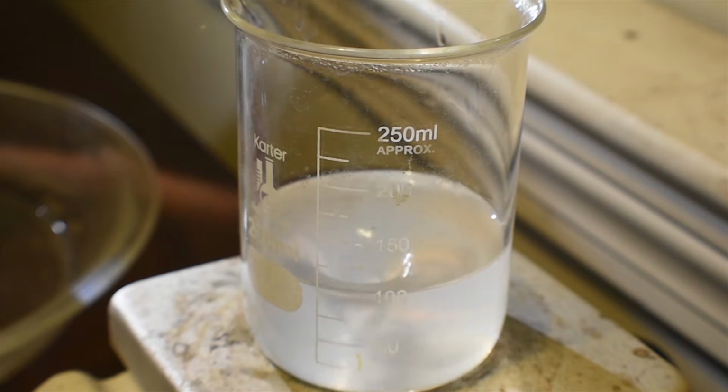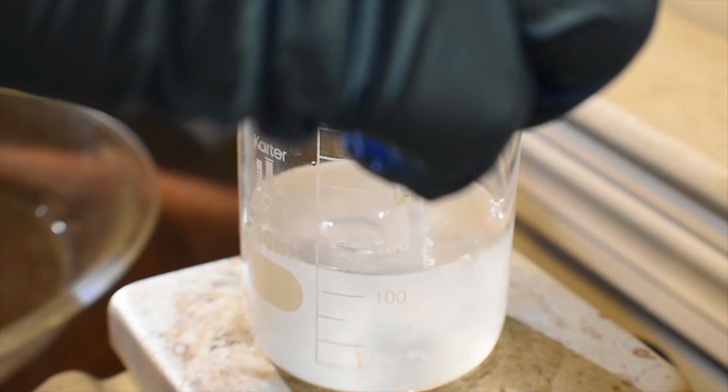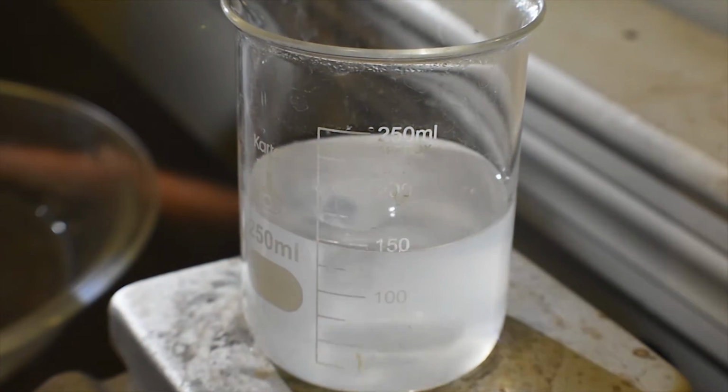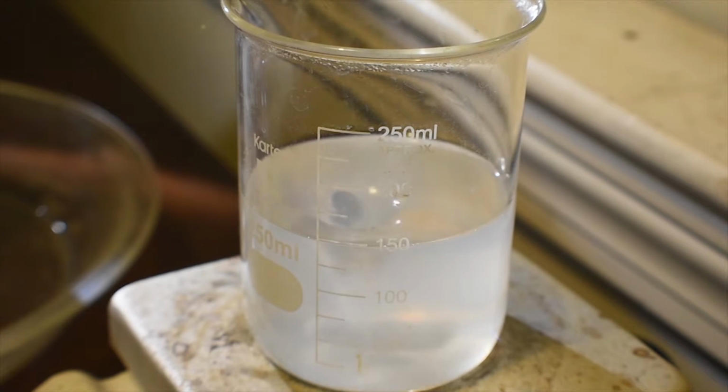This will serve the purpose of acidifying the solution because rhodizonic acid is more stable at lower pH. Here's the acetic acid. Great. From here, we have to cool it in an ice bath, and I really don't have a ton of ice on hand, so I'm just going to go outside and grab a lot of snow, I guess.